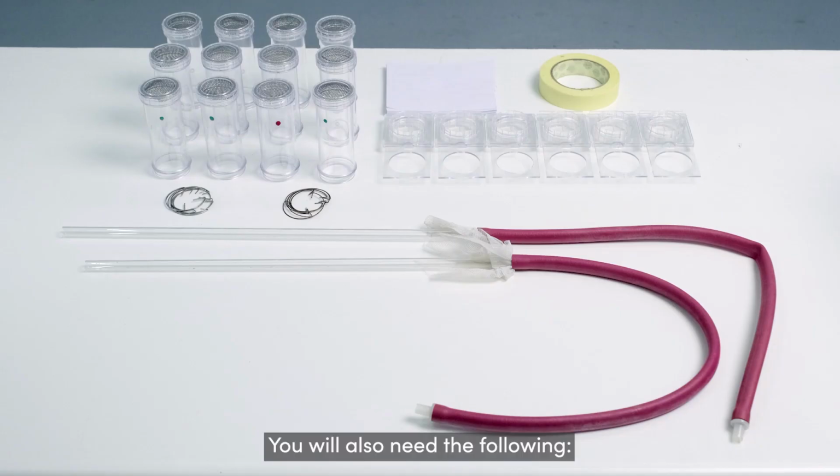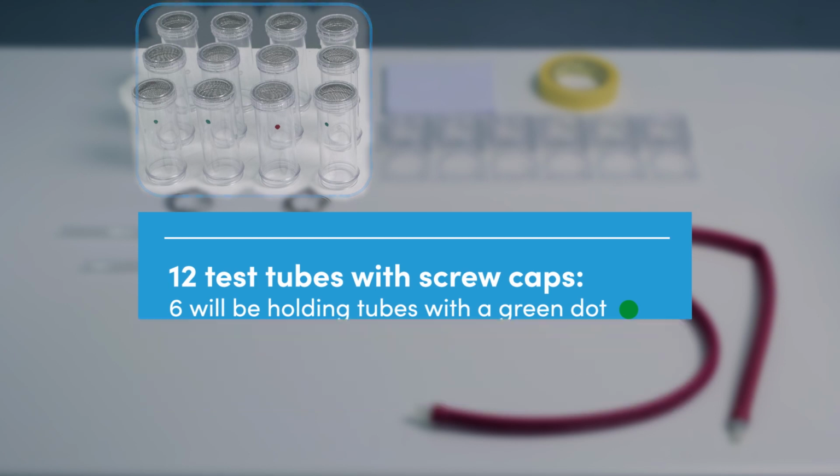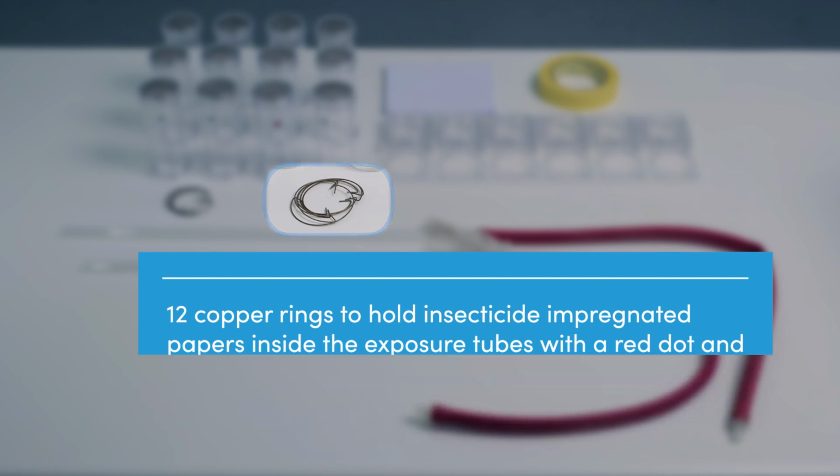You will also need the following: 12 test tubes with screw caps. 6 will be holding tubes with a green dot, 2 will be control tubes with a yellow dot, and 4 will be exposure tubes with a red dot. 12 steel rings to hold plain white papers inside the holding tubes, 12 copper rings to hold the insecticide-impregnated papers within the exposure tubes with a red dot, and the control papers within the control tubes with a yellow dot.